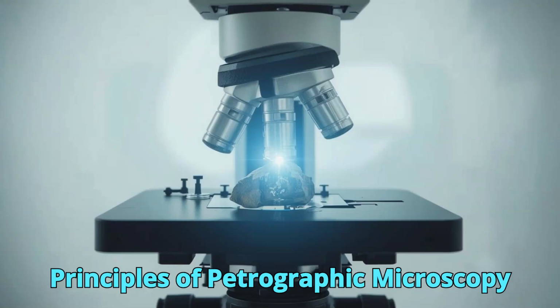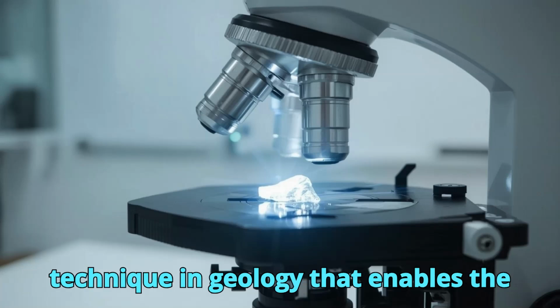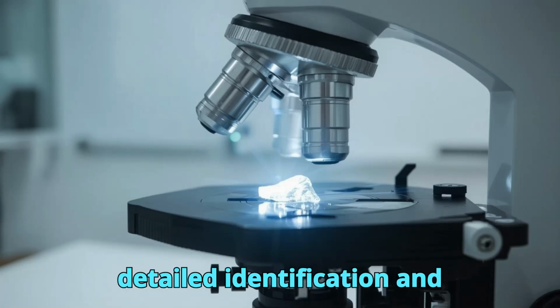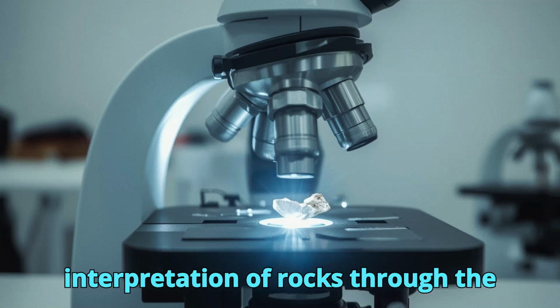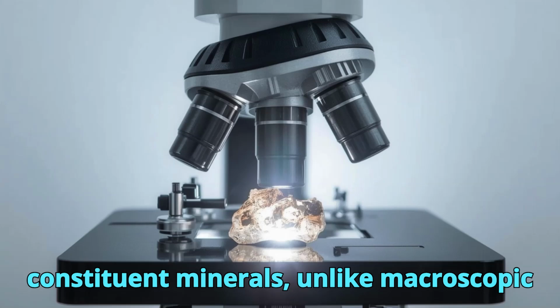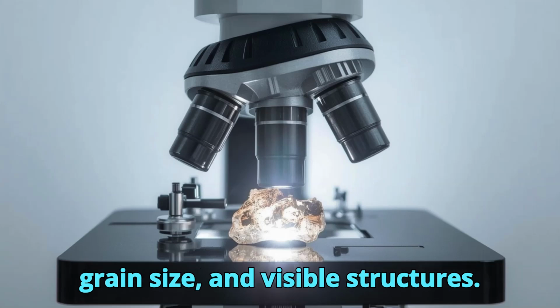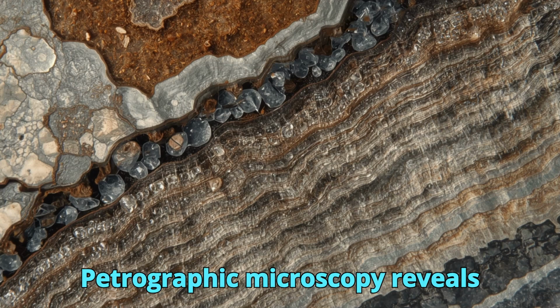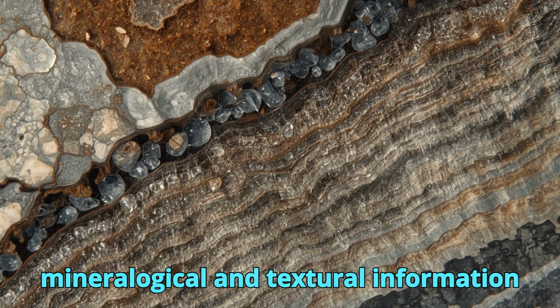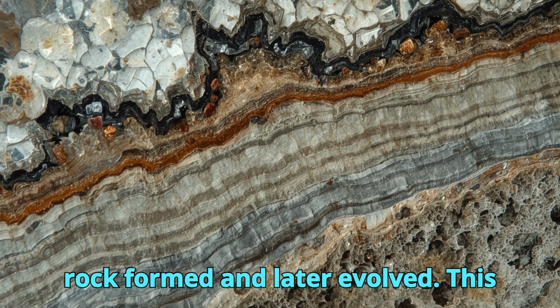Principles of petrographic microscopy. Petrographic microscopy is a foundational technique in geology that enables the detailed identification and interpretation of rocks through the microscopic examination of their constituent minerals. Unlike macroscopic observation, which is limited to color, grain size, and visible structures, petrographic microscopy reveals mineralogical and textural information that records the conditions under which a rock formed and later evolved.